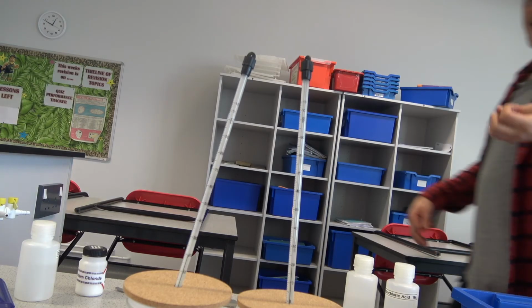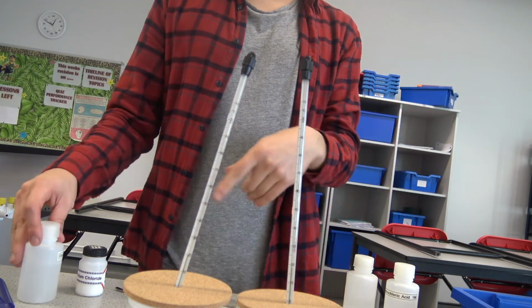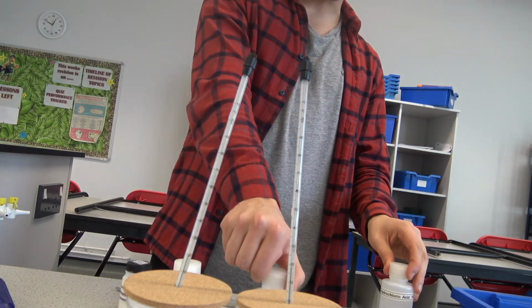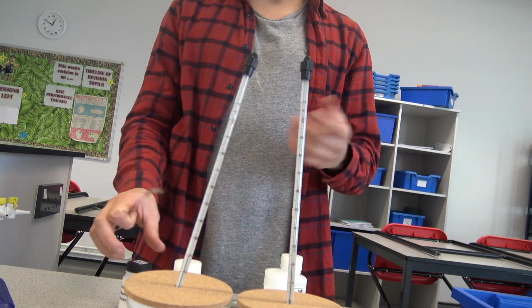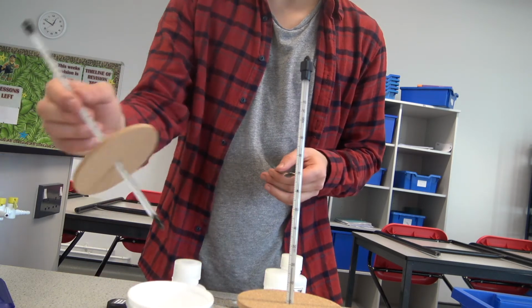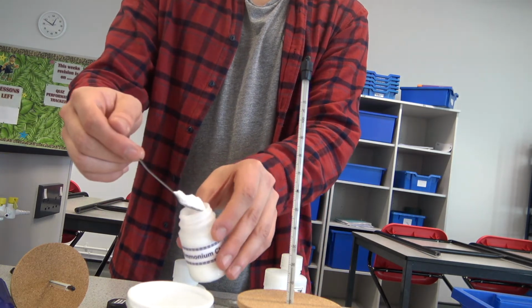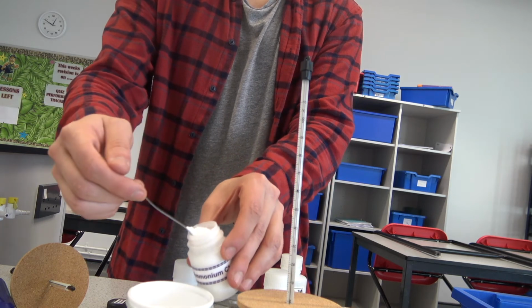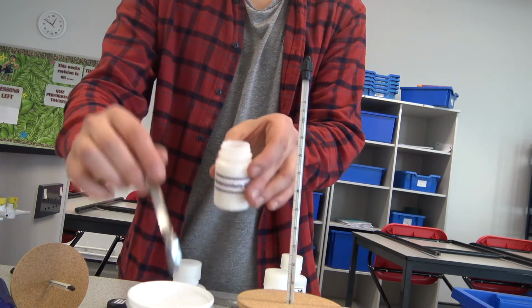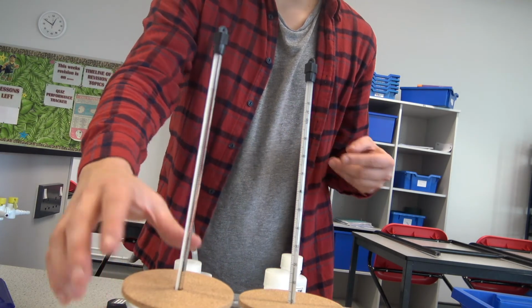Alright, so we've taken our starting temperatures of our two liquids that are already in there. On the right here I have some distilled water, and on the left I've so far added some sodium hydroxide. So now it's time for us to add the other reagent and measure to see how much the temperature goes up or down. You'll notice also the thermometer has a lid on top of it as well, and there's a reason for it. The lid is to make sure no heat escapes to the surroundings, and also you can see that the polystyrene cup is inside a beaker as well.